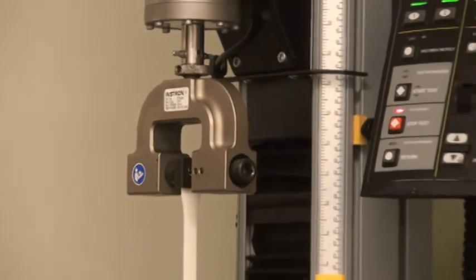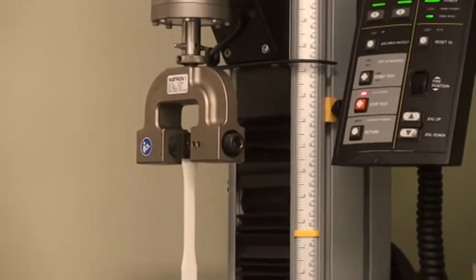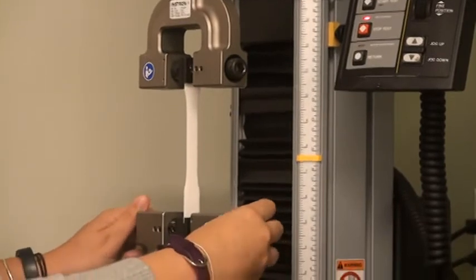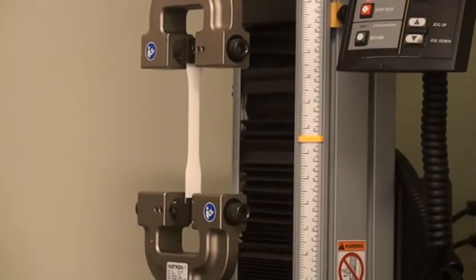To insert your sample into the lower grip, use the screw knobs to separate the jaw faces until they are far enough apart for your sample to slide in easily.